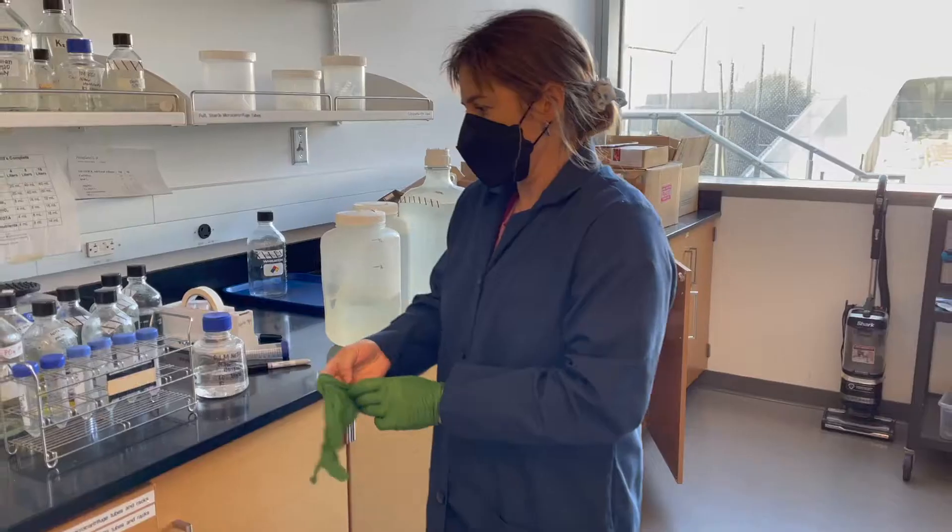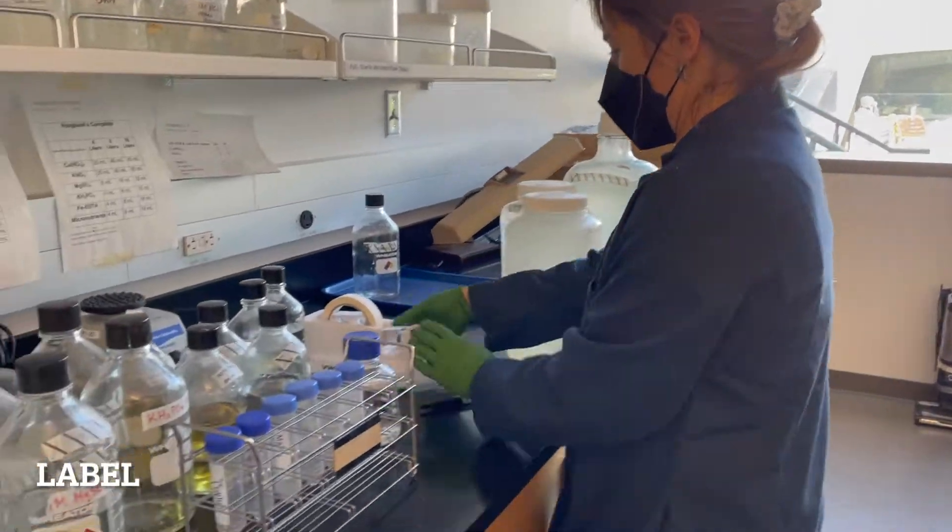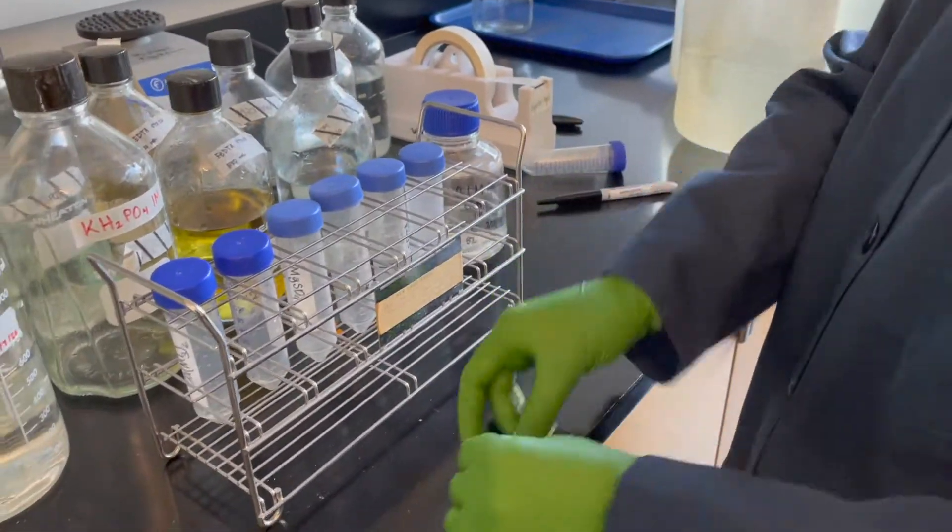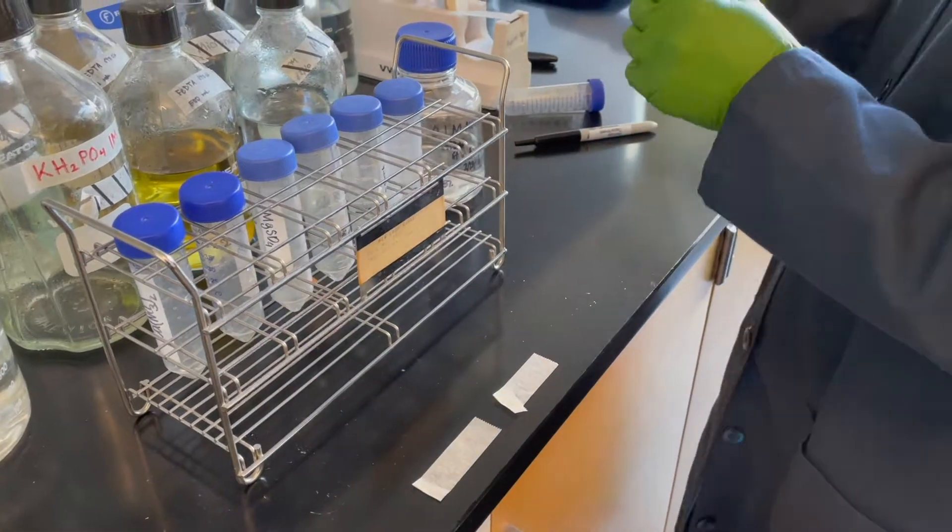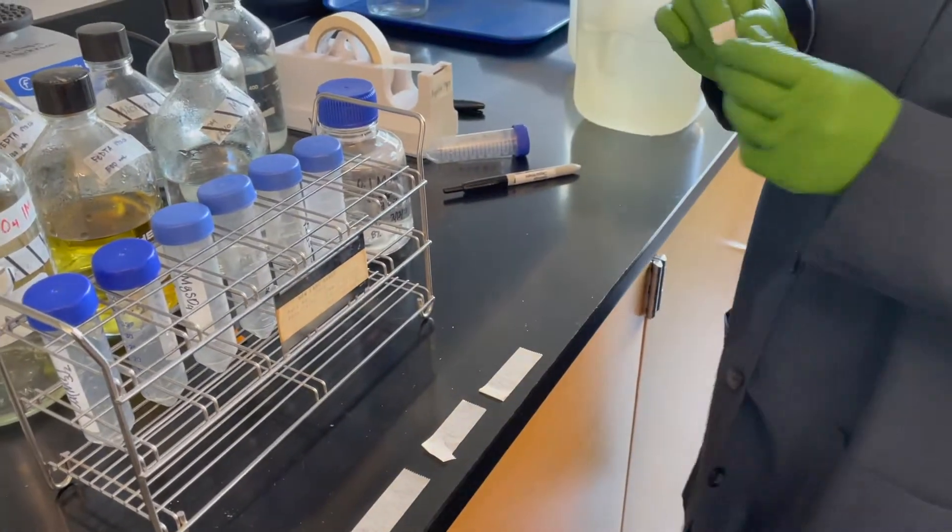I'm going to demonstrate a method for preparing multiple solutions that is mistake-proof. First of all, prepare labels before you put anything into your containers.